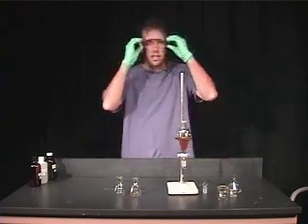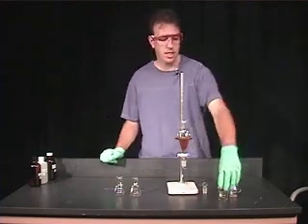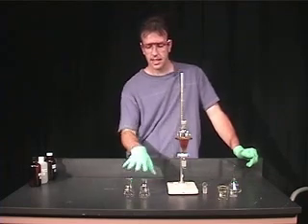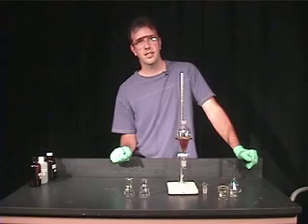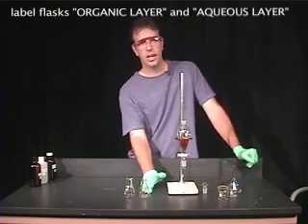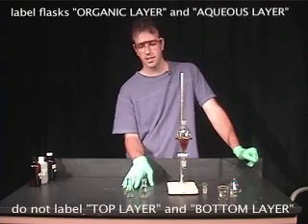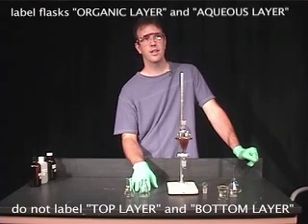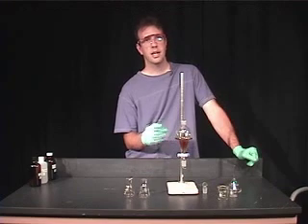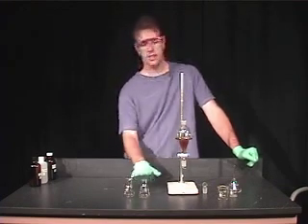While this is separating — it may take a little while — while the two layers are separating, you should label your collecting flasks. In this case I have two different collecting flasks: one labeled for the organic layer, and one labeled for the aqueous layer. It's very important that you don't label these 'top layer' and 'bottom layer,' because that's not very descriptive — the top layer and the bottom layer may change depending on the densities of your solvents. So: organic layer, aqueous layer.